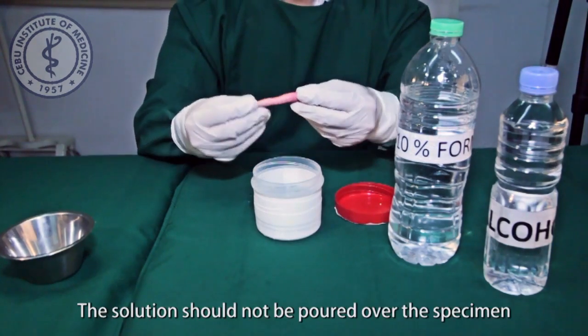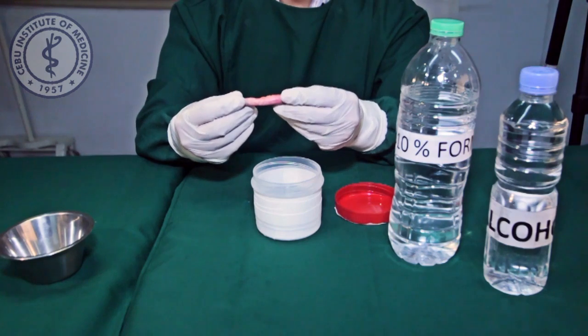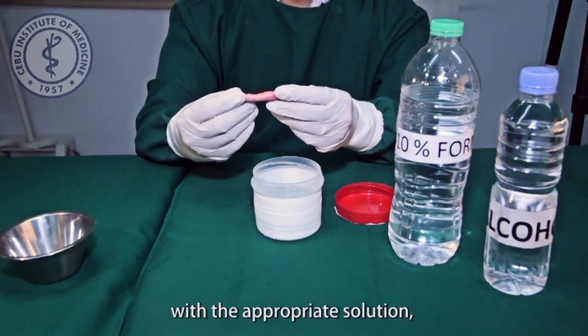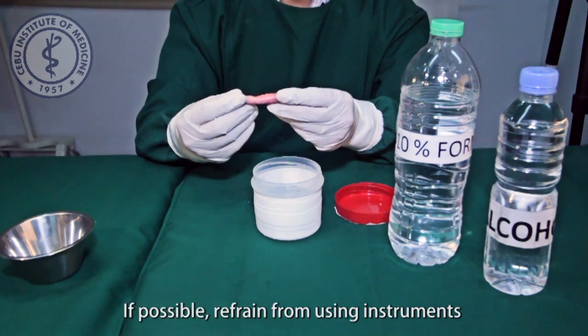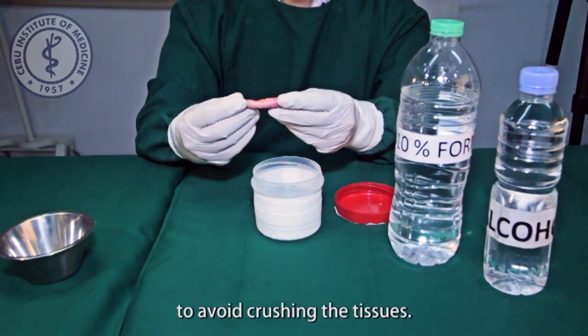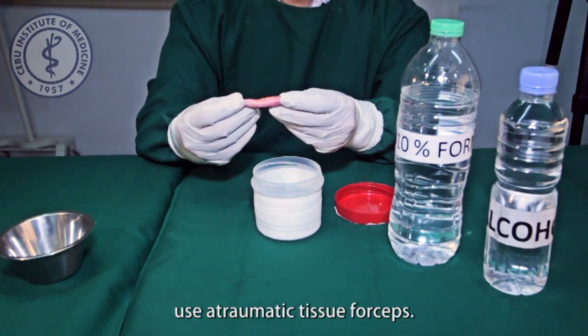The solution should not be poured over the specimen to prevent splashing. In placing the specimen into the container with the appropriate solution, it should be handled gently by gloved hands. If possible, refrain from using instruments to avoid crushing the tissues. If you should use an instrument, use an atraumatic tissue forceps.